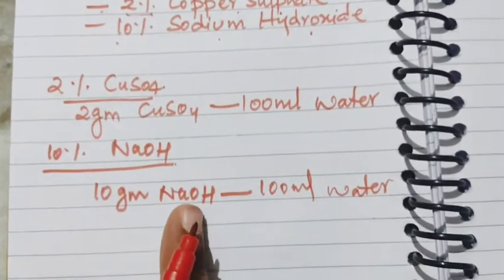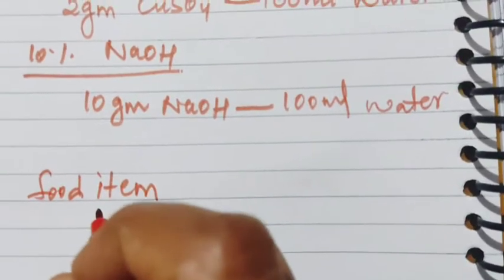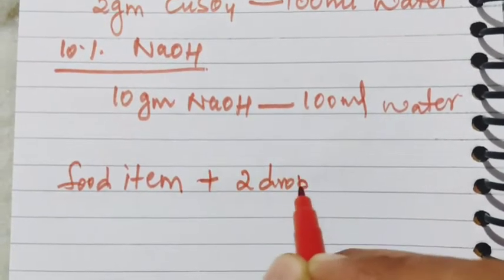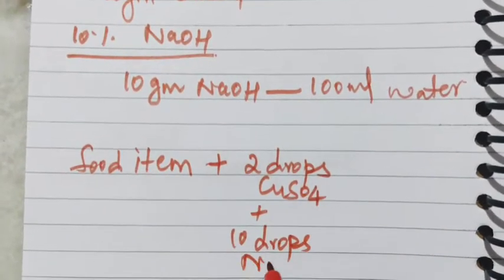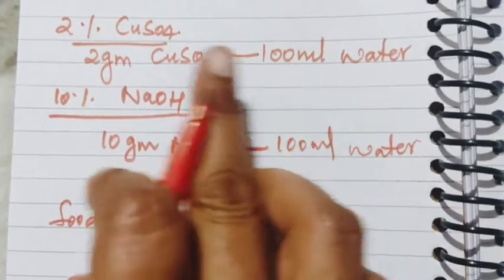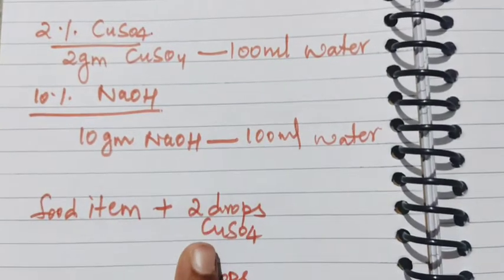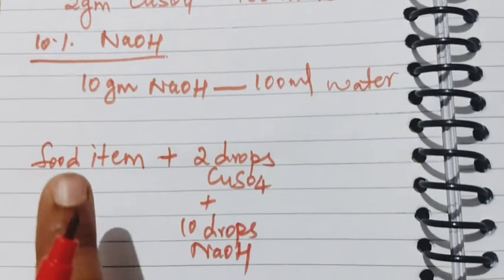As the 2 solutions are ready, we take the food item which we want to test for proteins. If the food item is in solid form, add a little bit of water to make it a solution. To the food item, we add 2 drops of copper sulfate solution and 10 drops of sodium hydroxide solution which we have prepared earlier. These two solutions are added to the food item which we are testing for proteins.